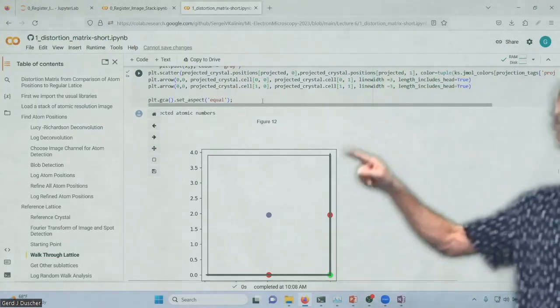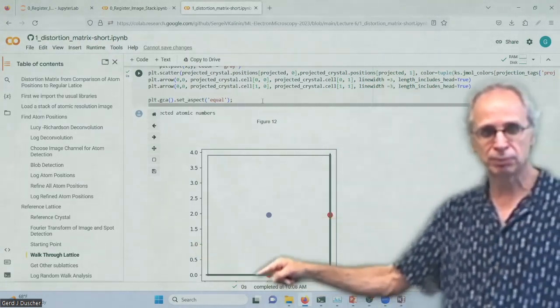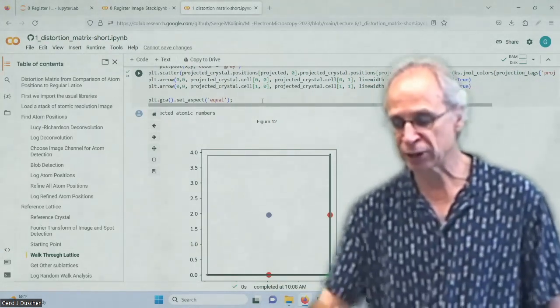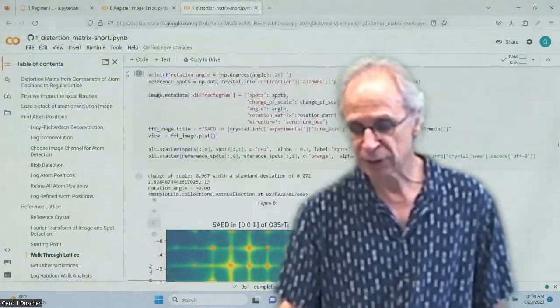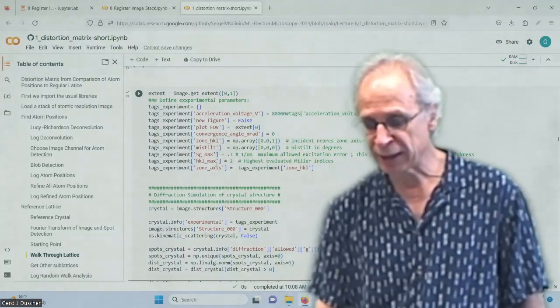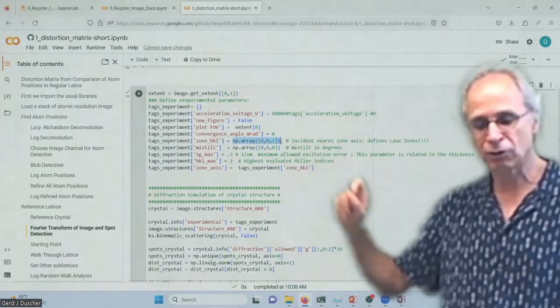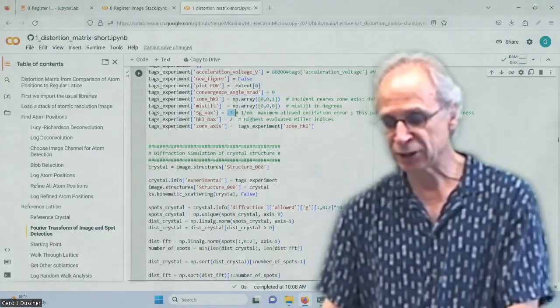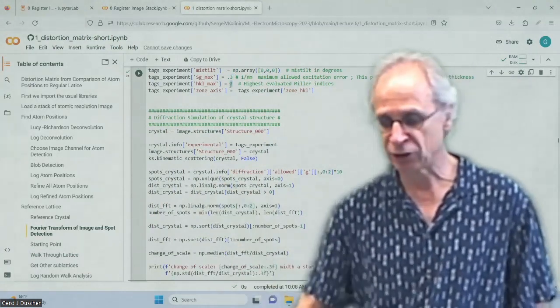This is our unit cell, and these are the steps that I want to run through my atom positions, right? I know where the oxygens are. What I get is always the origin of my projected unit cell. And the projection is done as we did before. So I determine up here in my experimental condition my zone axis. So it's a 0, 0, 1. Put it here. Okay. This is my zone axis. I have determined strontium titanate, no mistilt, and I have my excitation error, which gives me how many spots I get, right? It's a thickness equivalent, and it gives you a maximum amount of HKL.